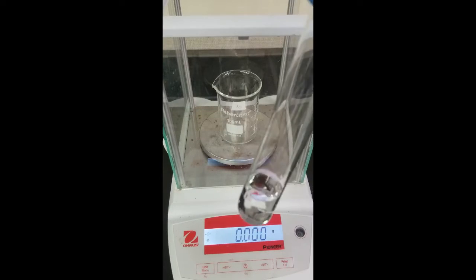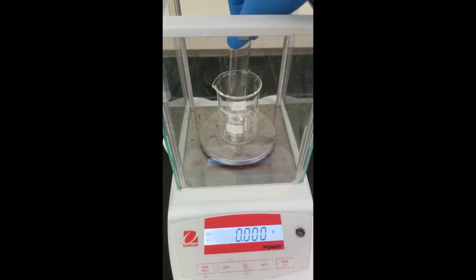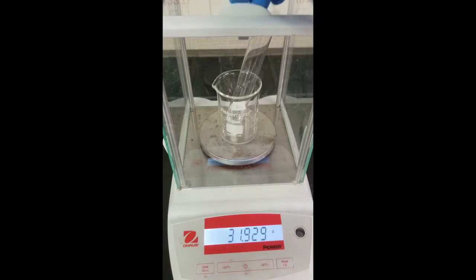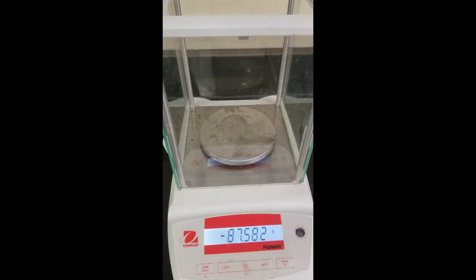All right, so you can see our cyclohexane has melted back into a liquid, so let's reweigh it. It is possible that some of the cyclohexane evaporated away, so we got a tared beaker in there. Weigh it up. Got that mass right there. And now we need to add 0.1 to 0.2 grams of our unknown. For unknown, we're going to choose unknown A right here.